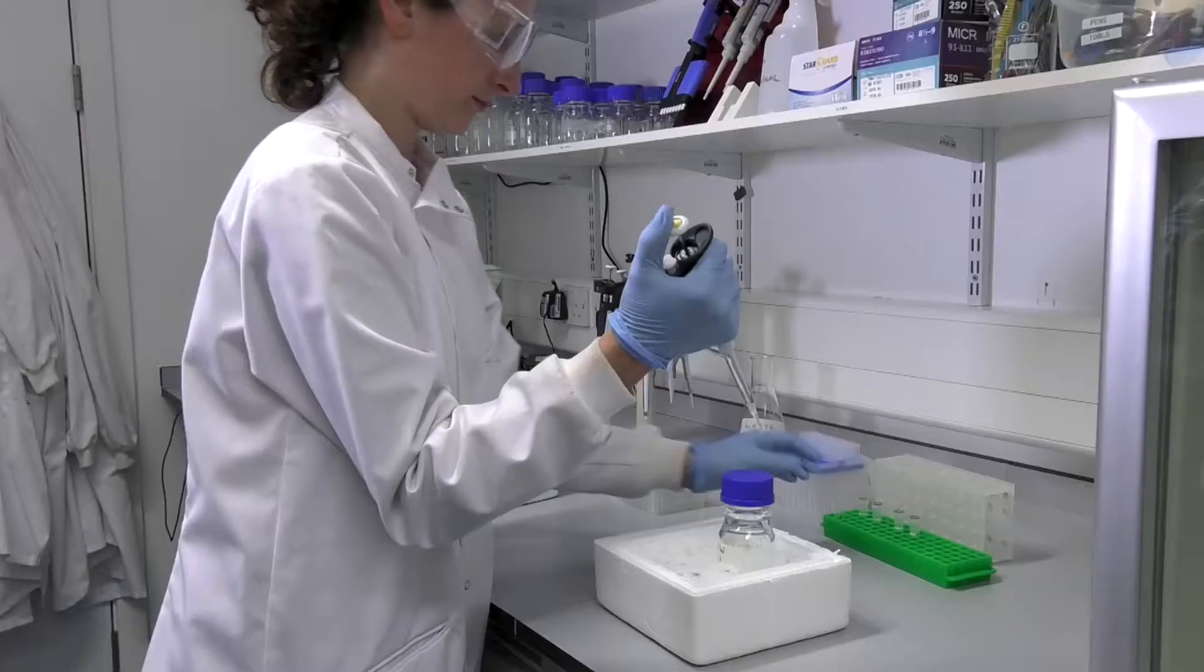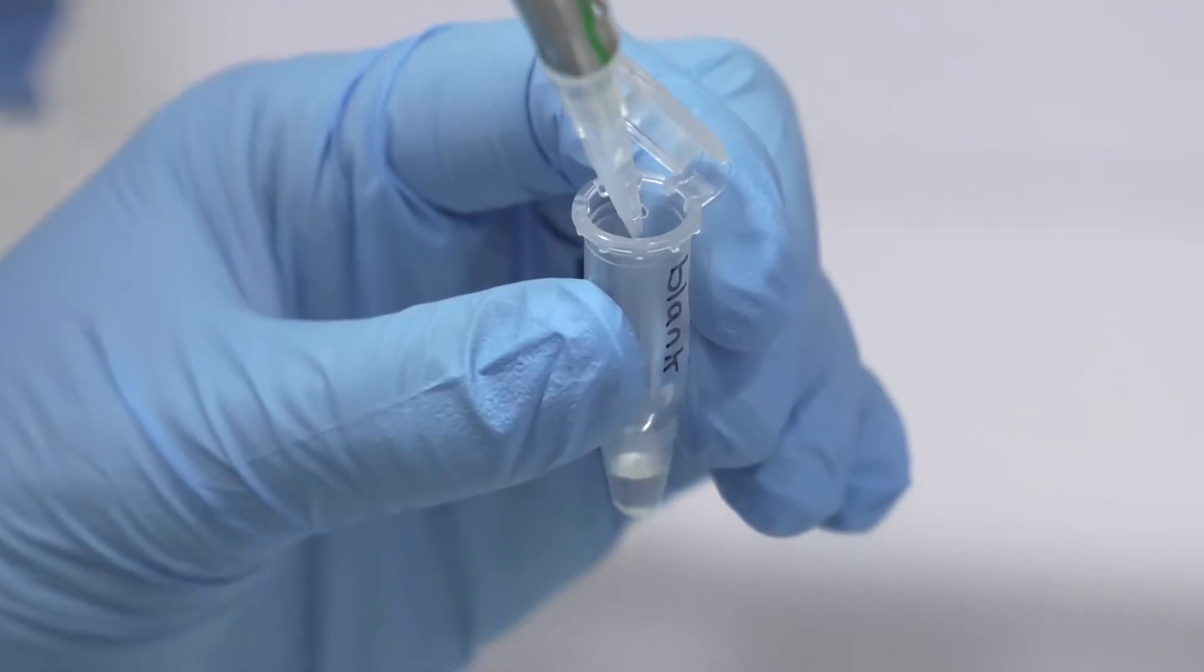Step 5. Prepare a blank sample of 200 microlitres of extraction solvent and process it alongside your other samples.